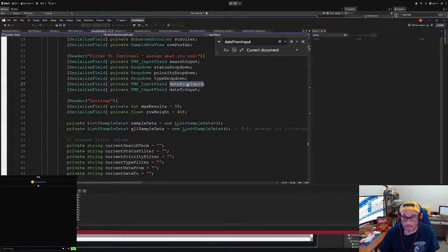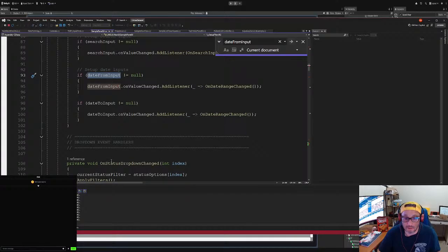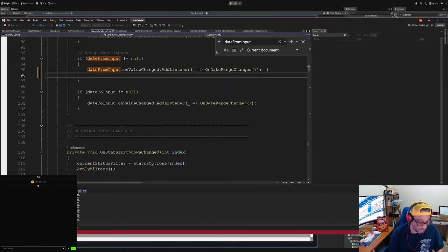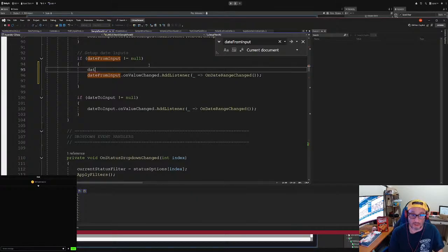Okay, so add listener, right? It's not "no add listener", but we want to go from date. But before we do that, because if not, it's going to set off the listener already. So we're going to say date. Oh no, it's date input to input from date, date from input value, right? The value text. I think it's text.